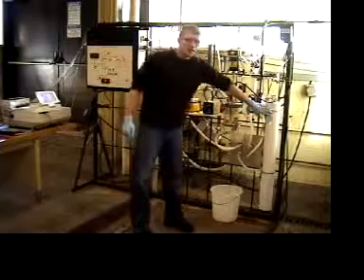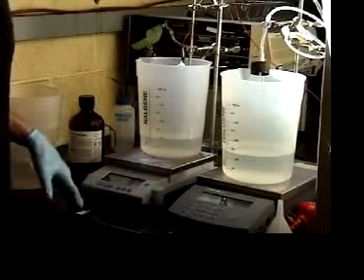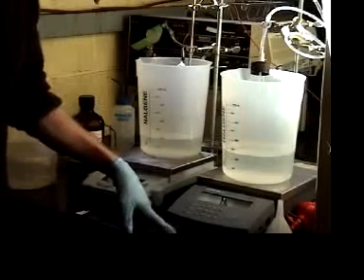This is CSTR and PFR. These are your feeds. It's pump one and pump two, and they'll be labeled on the pumps.